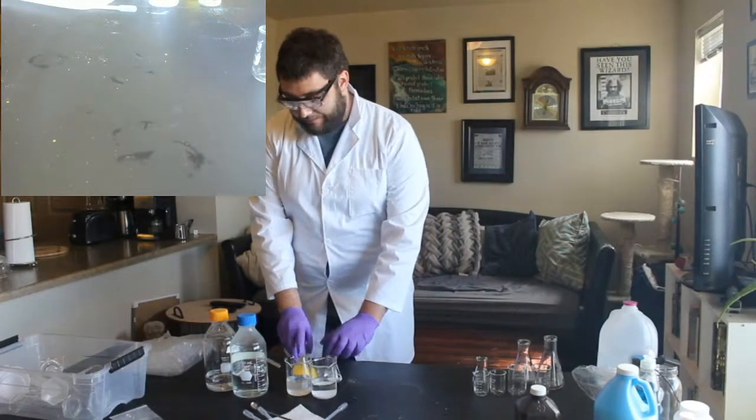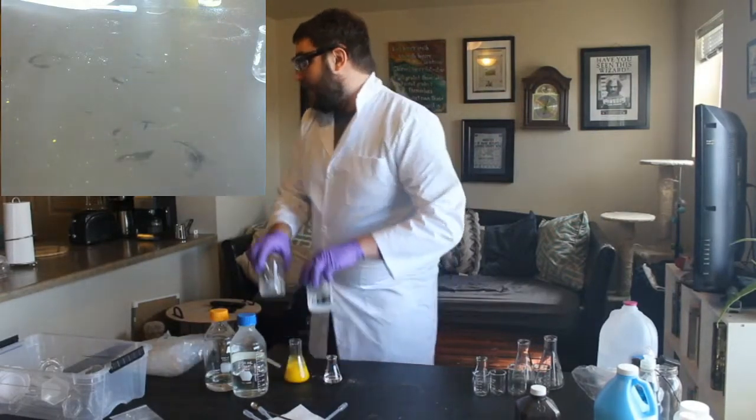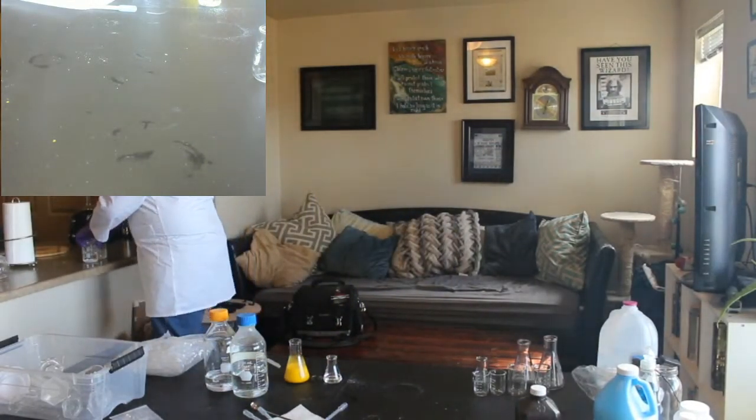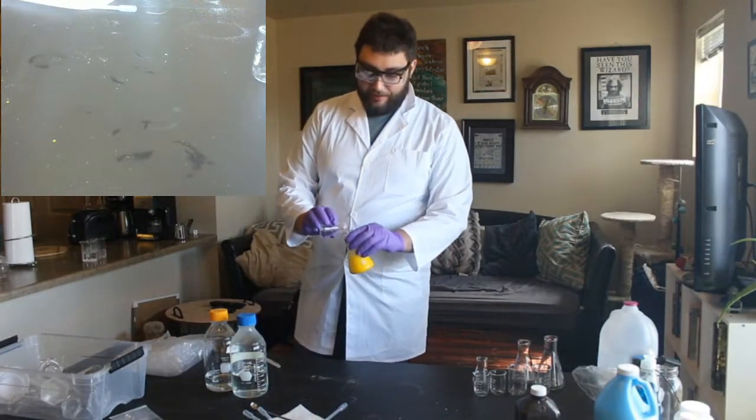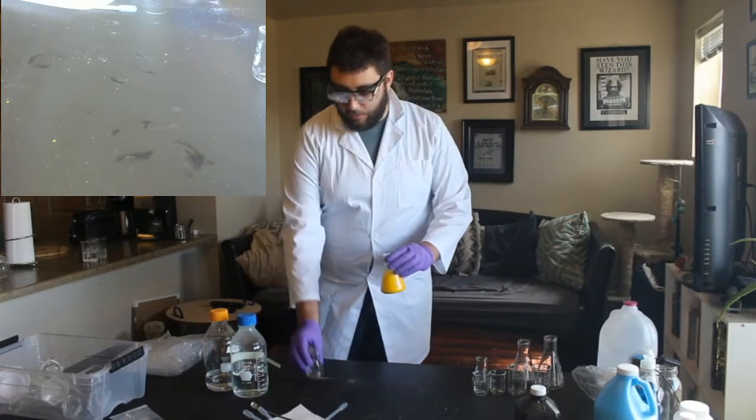So I'm going to set these off to the side for now. If we have some extra time, there's another really cool thing we can do with this gold one. But it takes a little bit of time. So we'll have to see where we're at.